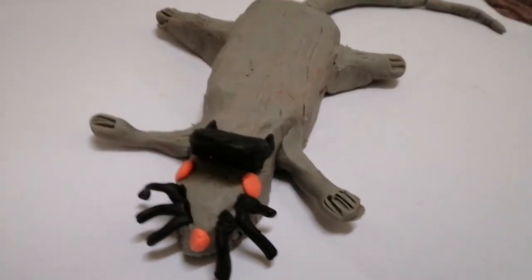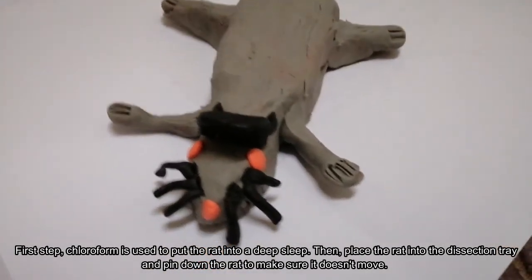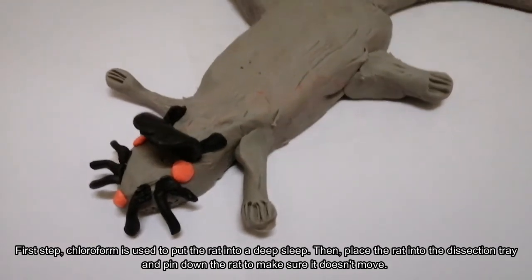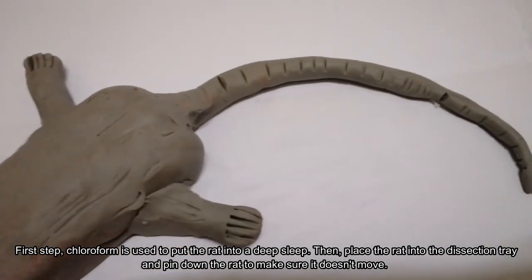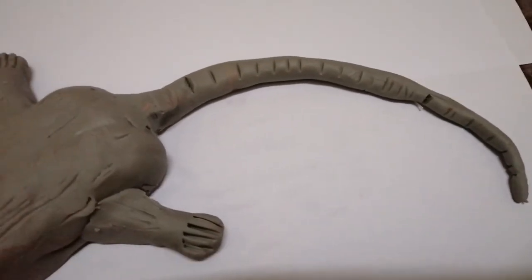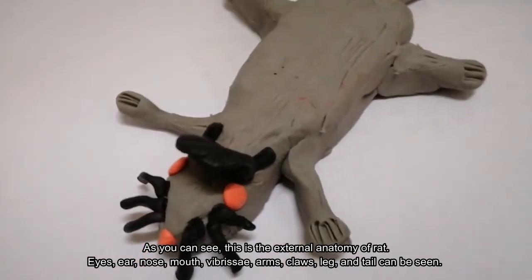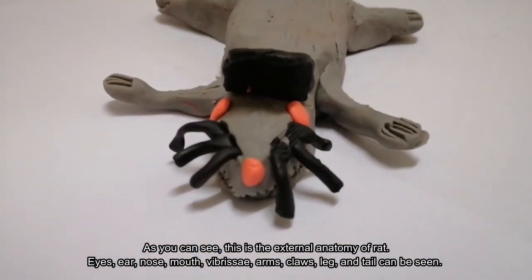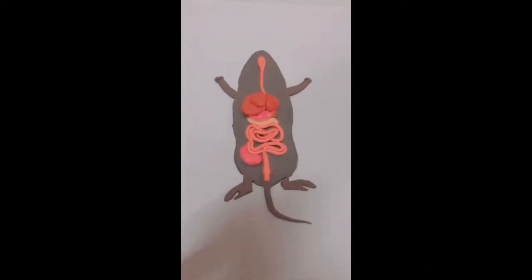Let's begin our dissection. The first step is that chloroform is used to put the rat into a deep sleep. Then the rat is placed onto the dissection tray and pinned down to make sure it doesn't move. As you can see, this is the external anatomy of the rat. Eyes, ear, nose, mouth, vibrissae, arms, claws, leg, and tail can be seen.